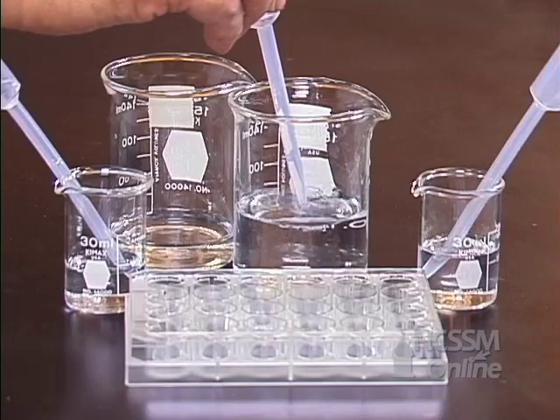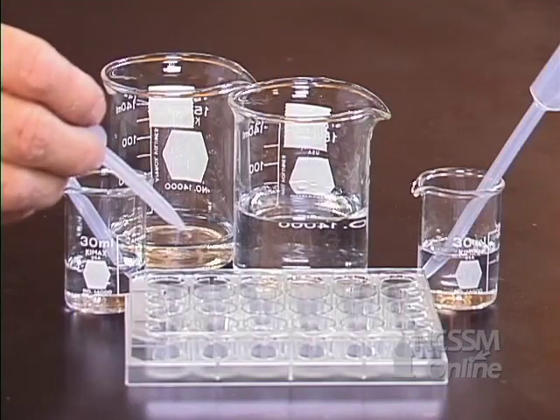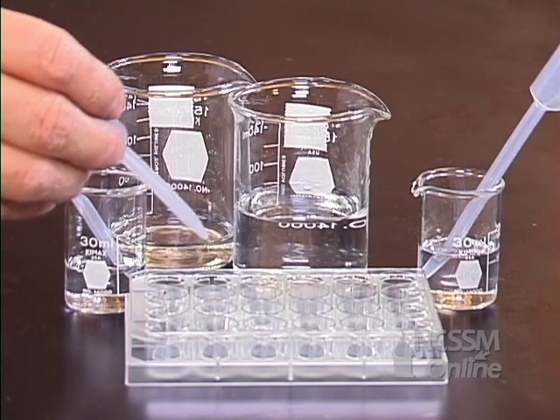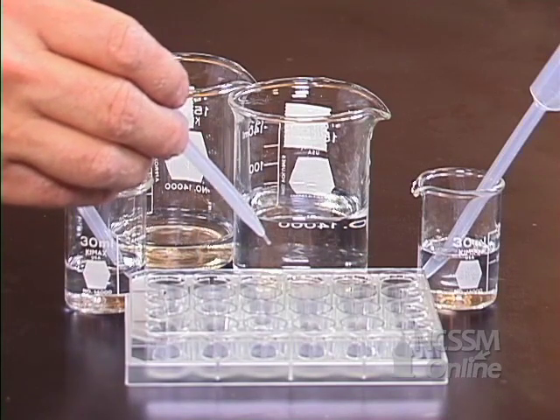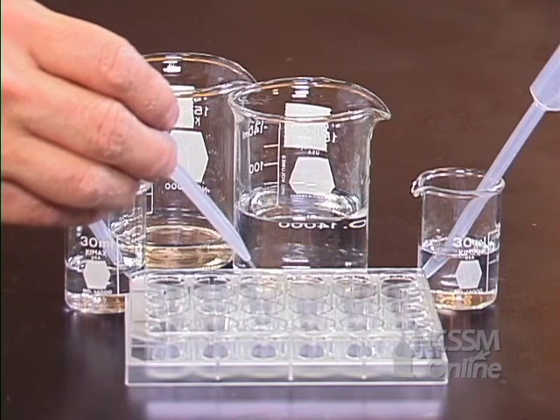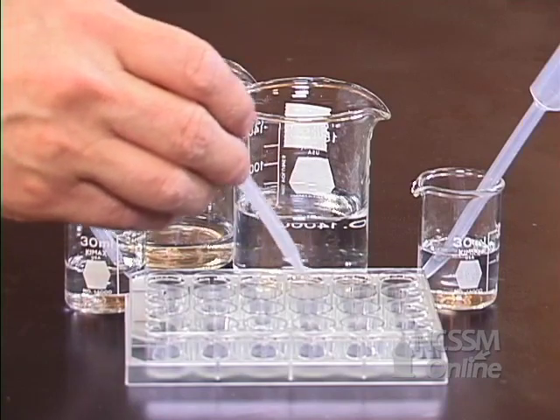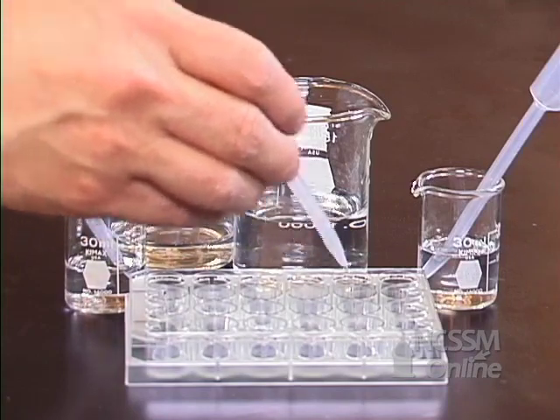Repeat this procedure by taking 3 drops from the second well and transferring it to the third well. Rinse out your dropper thoroughly with water. Add 27 drops of water. Then take 3 drops from that well and add it to the next well until you have all 6 wells. This should give you a pH of 1 through 6.